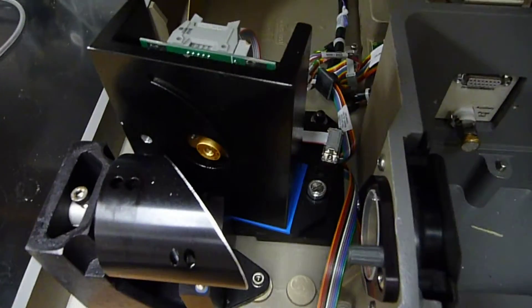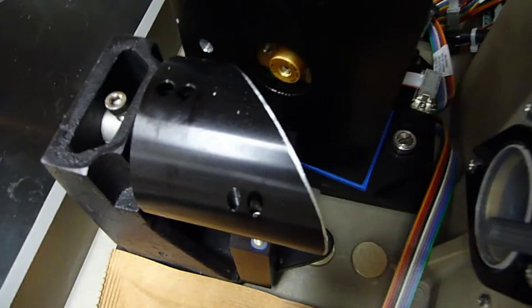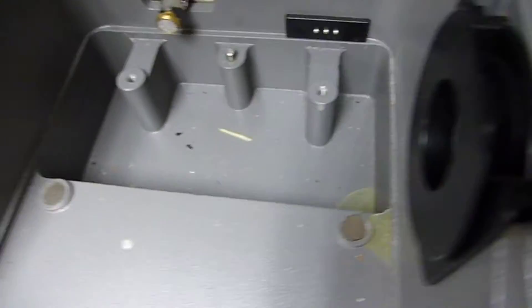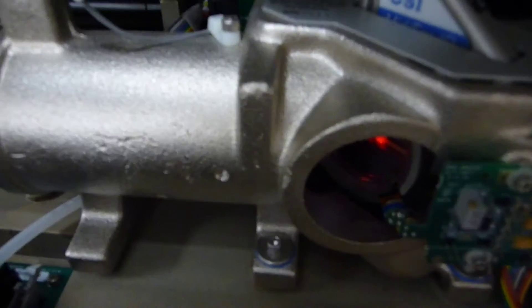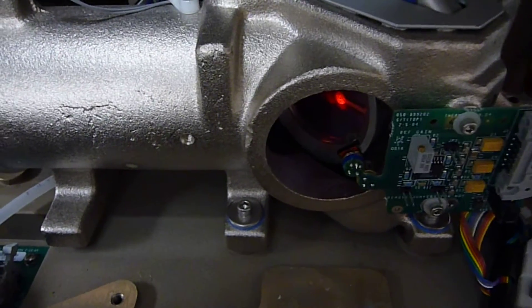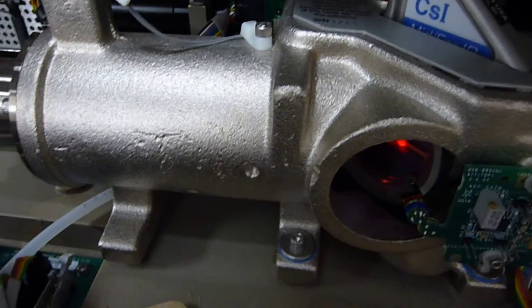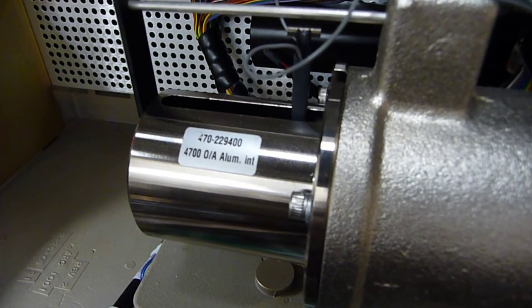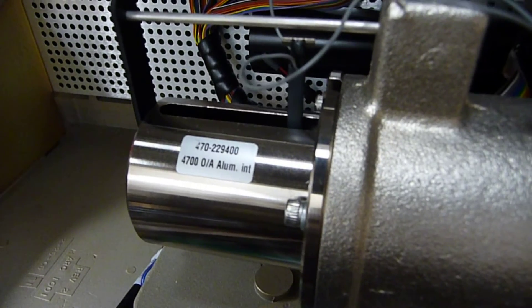So here's the detector — it's a little gold-colored thing. And this is where the sample compartment is. The mirror. To the beam splitter, and you can see the sparkle — that's due to the laser. The purpose of the laser is to track the movement of the mirror. And so you can see the mirror.